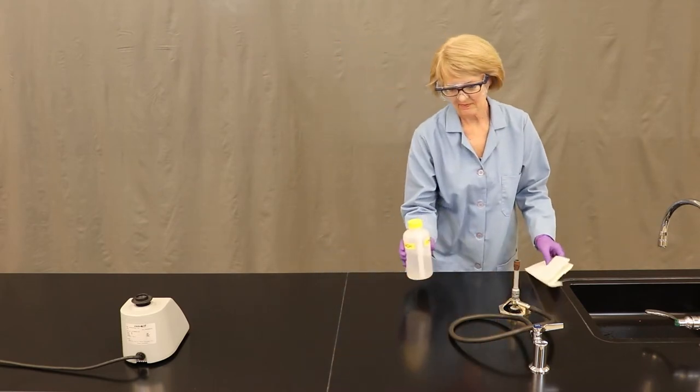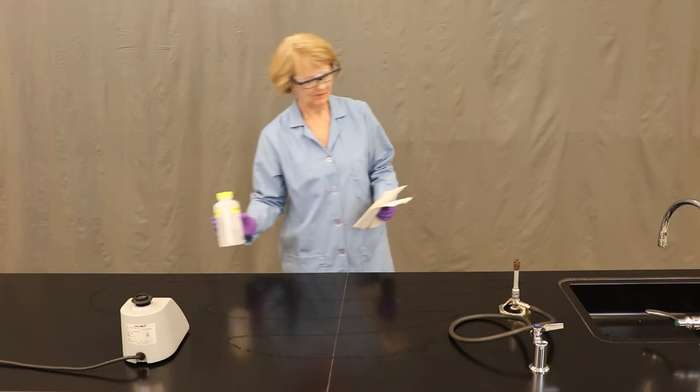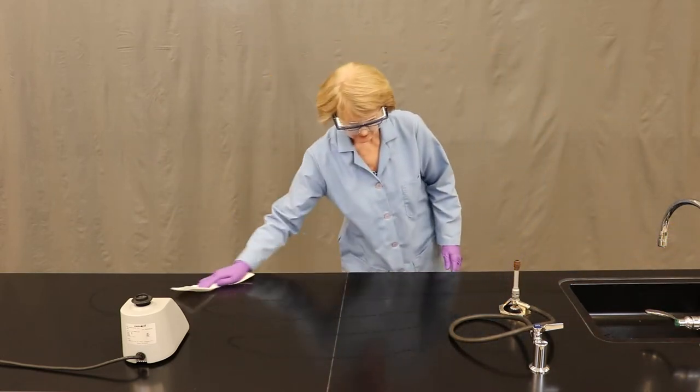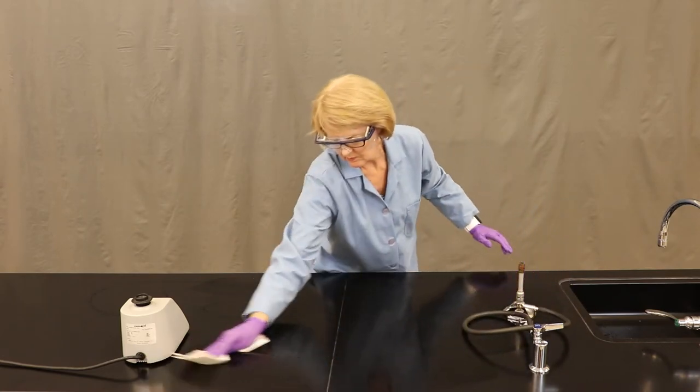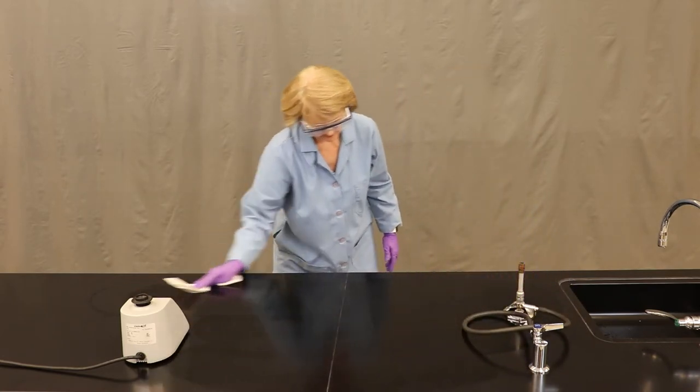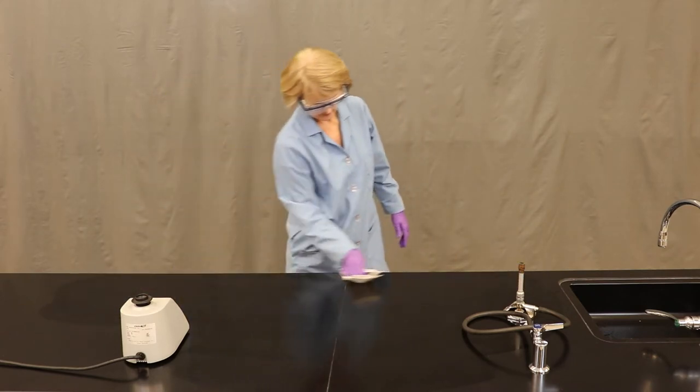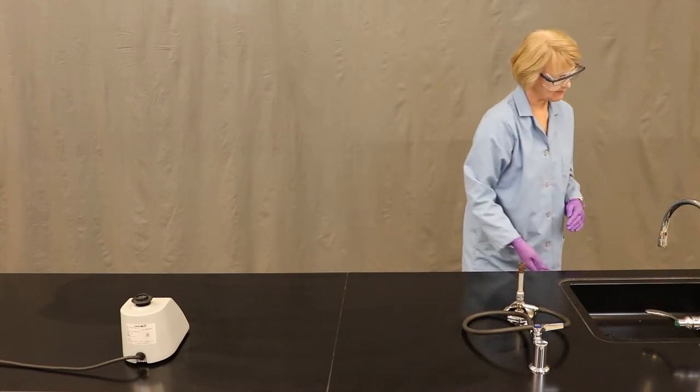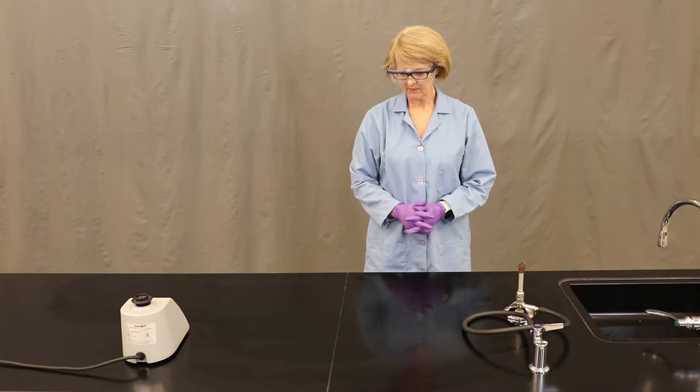The next thing you want to do before you get started is disinfect your workspace. In this case we're going to work with a 10% bleach solution and wipe our bench space down with regular paper towels. These paper towels are not currently soiled with live bacterial organisms, so we're going to dispose of them in regular trash.